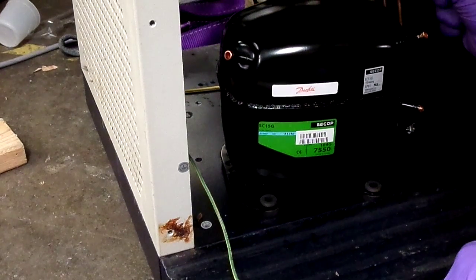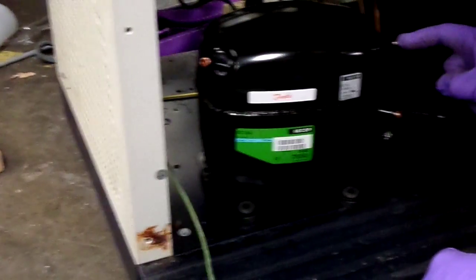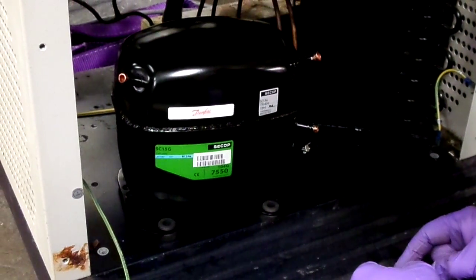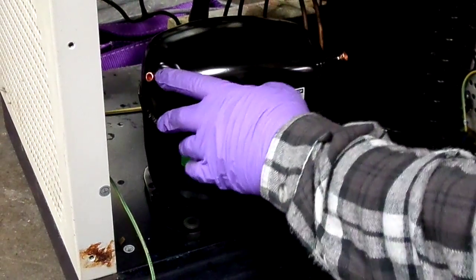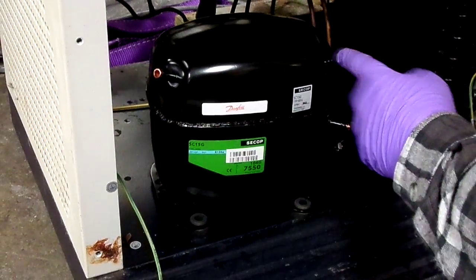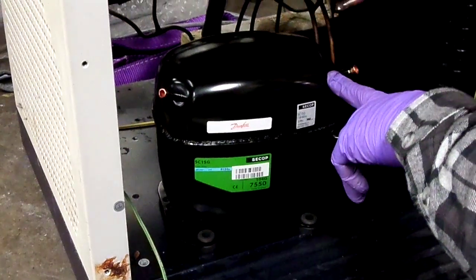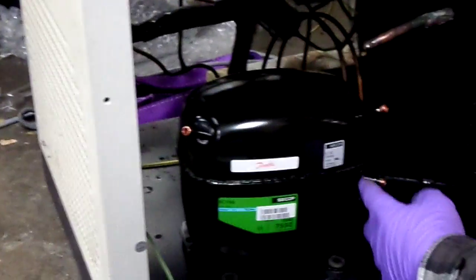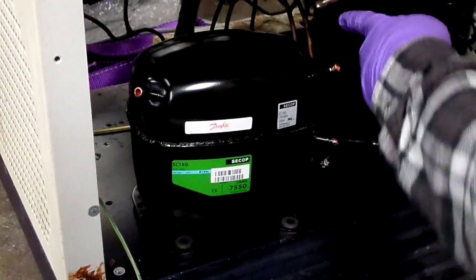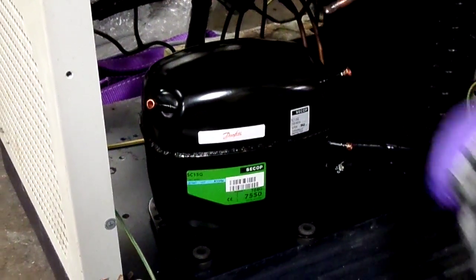Now, as you can see, this pipe here is larger in diameter than the return line of the compressor. So you can see the two inputs, the suction. Actually, I'm sorry, that's the suction, and then you have the larger line that goes into the top of the dome. That's going to be your return line, and then your output is always going to be the lowest hot one. Yeah, that's the hot one. So as you can see, the diameter of this pipe is larger than the return on the compressor.